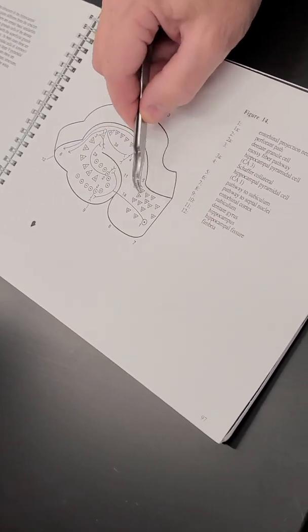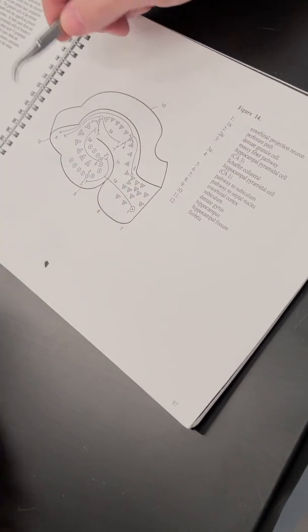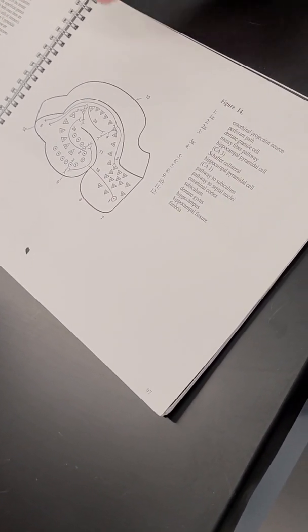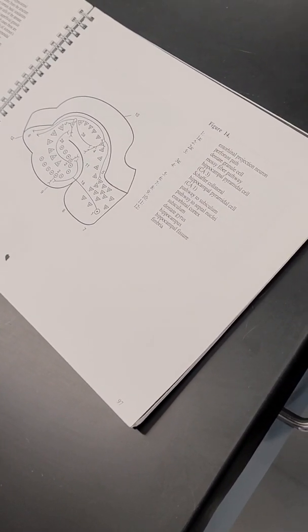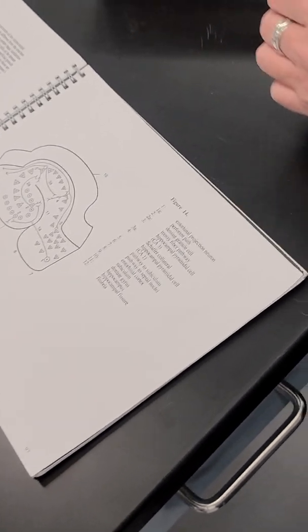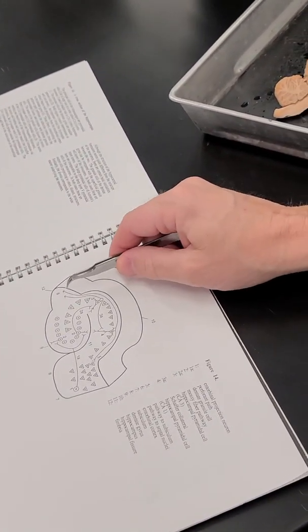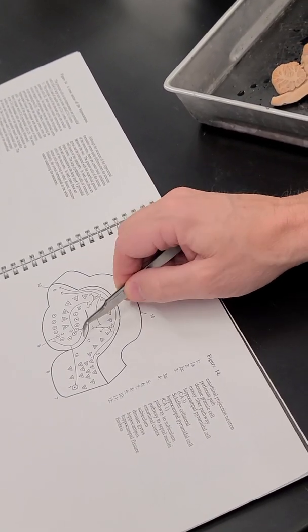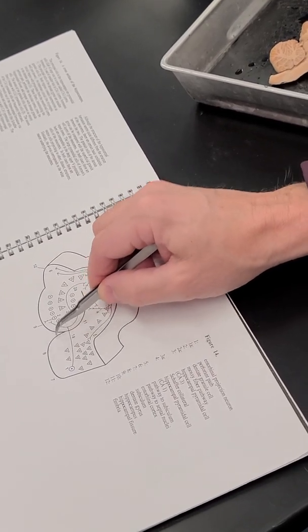And the subiculum is this area right next to it. So the hippocampus is organized like the rest of the neocortex in that the deep layer is fibers like the internal capsule. And that's the alveus and the fimbria. Those are the fibers that go into and out of the hippocampus. And then this would be the superficial or surface layer of the cortex.